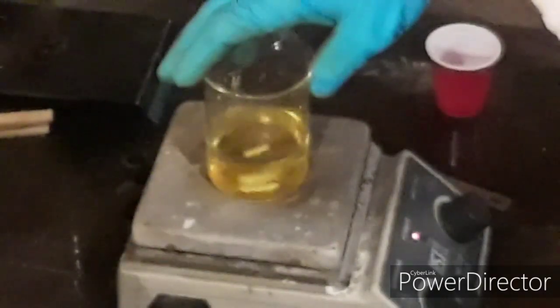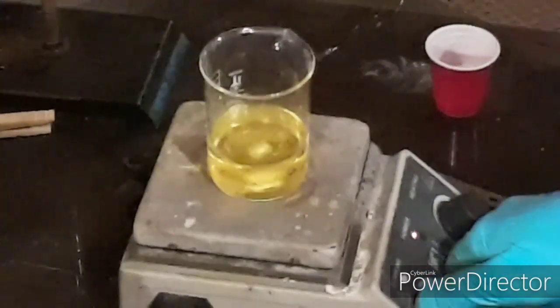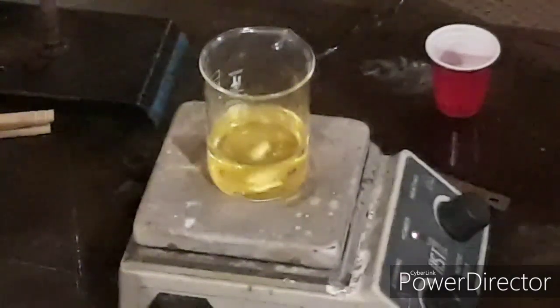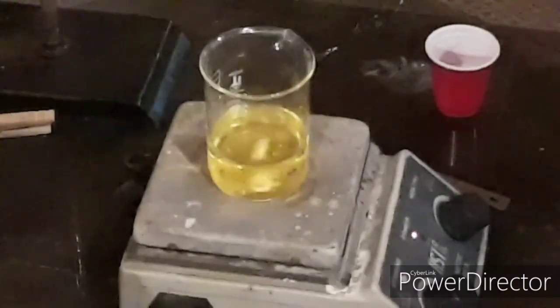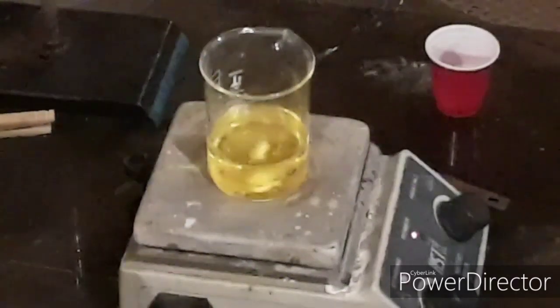In this beaker with the stir bar I have approximately 65 milliliters of 68% nitric acid, and I'm going to turn on stirring. I am going to be making calcium nitrate, and I'm going to use this in a future video to again make nitric acid. However, the nitric acid I'm going to be making from the calcium nitrate is going to be higher than azeotropic — I'm shooting for around 90% nitric acid.